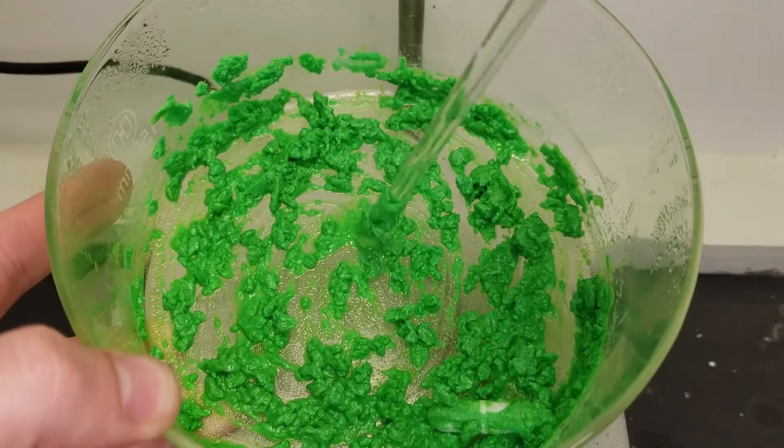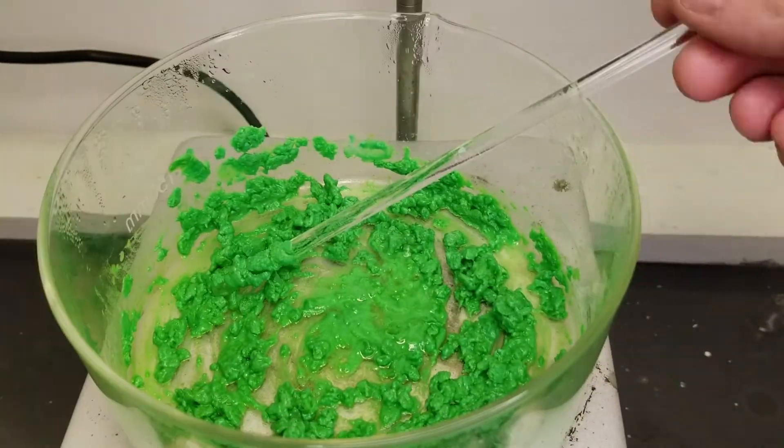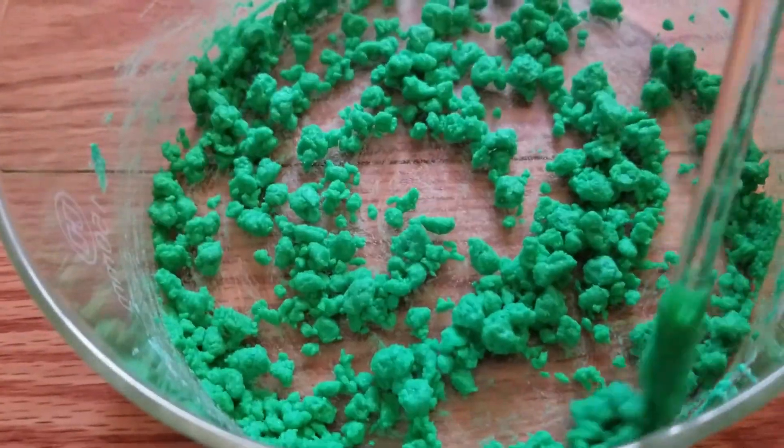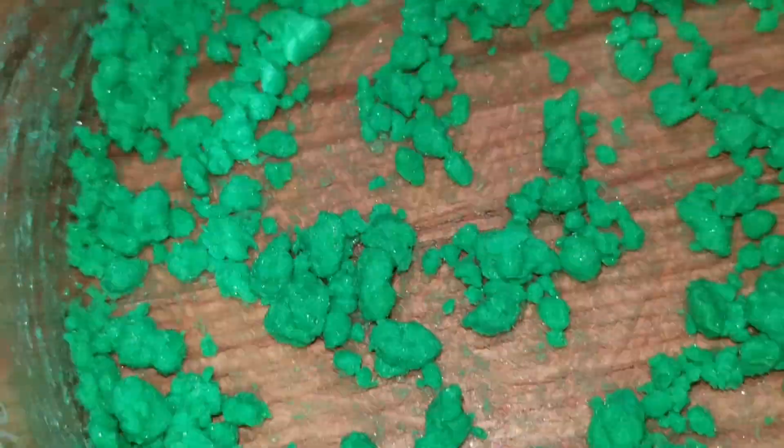With time and stirring, the crystals slowly dry. I am eventually left with some very pretty copper chloride that is fairly dry.